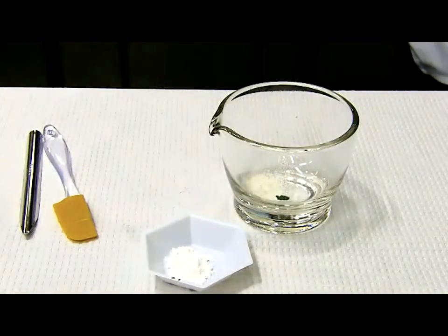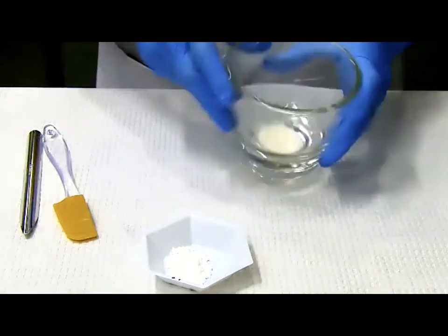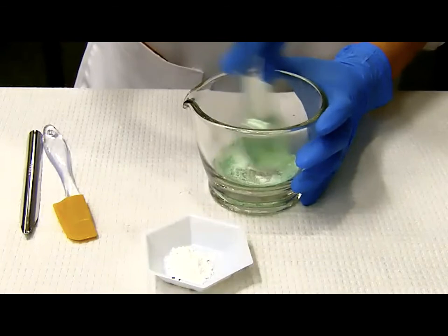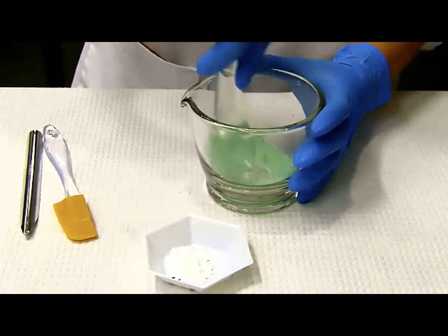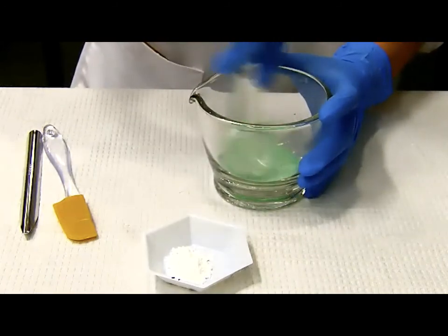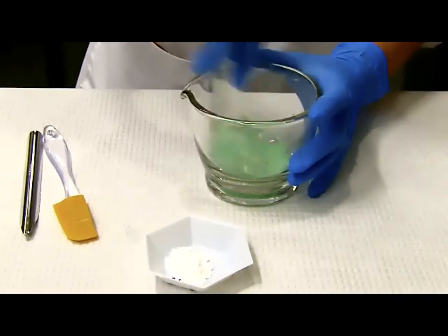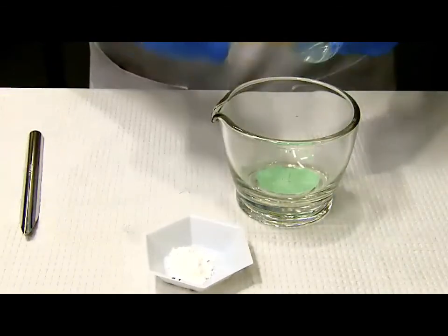So let me just clarify this, because this has been a question that's happened this week. Why add the food coloring? Why is Judy adding food coloring here? Because do you see that the powder in the mortar is almost identical in color to the lactose, the white and the white. So by doing this, we're coloring the active ingredient to help visualize the geometric dilution. Okay, so if you already had a colored active ingredient, you don't need to add external color. But in this case, they were identical. So she's coloring the active ingredient green, so that we can visualize the mixture with the white lactose.